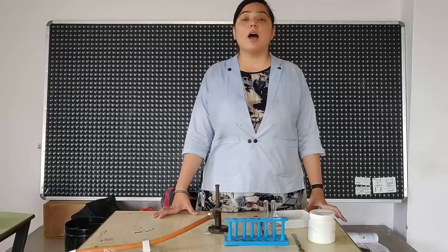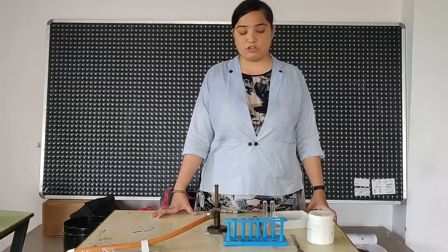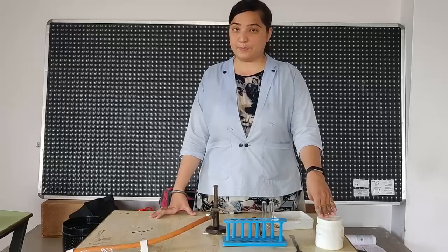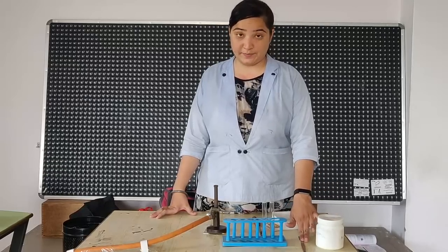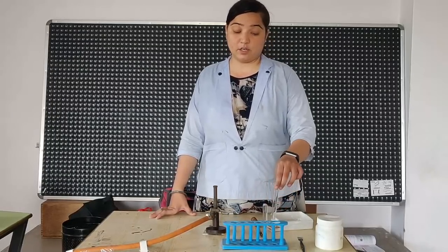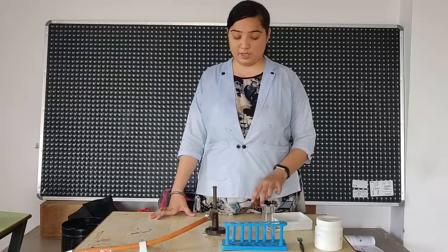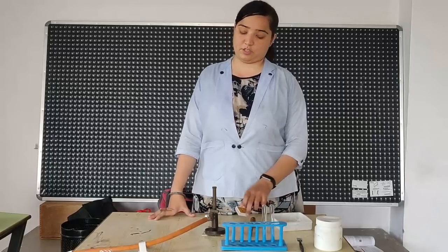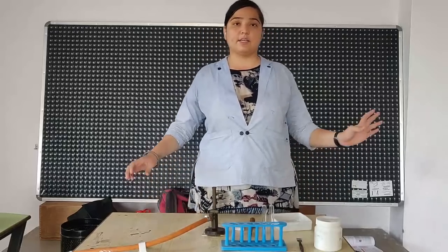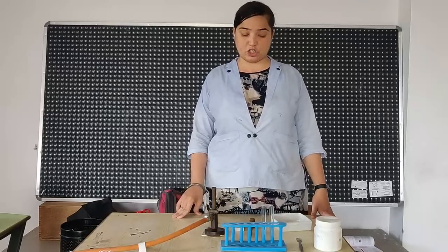So, here are the substances which are needed for the formation of nitrogen dioxide gas. Lead nitrate, spatula for properly dipping it into the test tube, test tube stand, the test tube holder and matchbox, the burner. Now one by one, let us start on with the whole of the experiment.